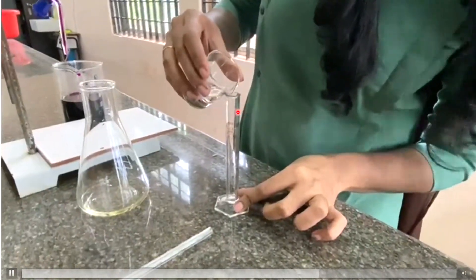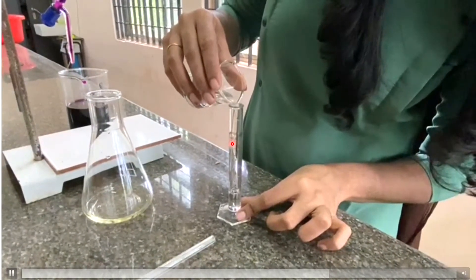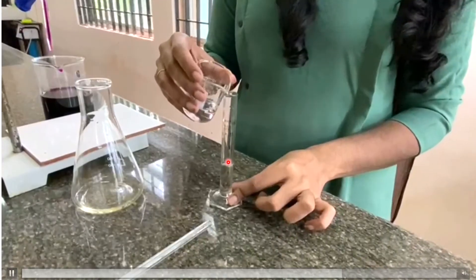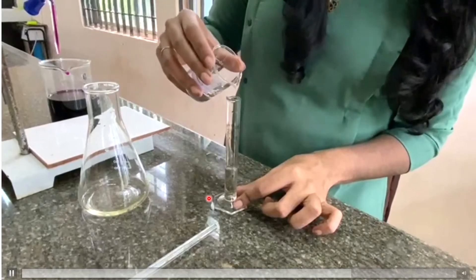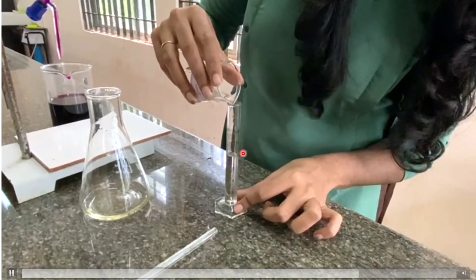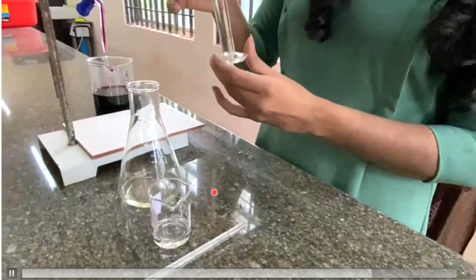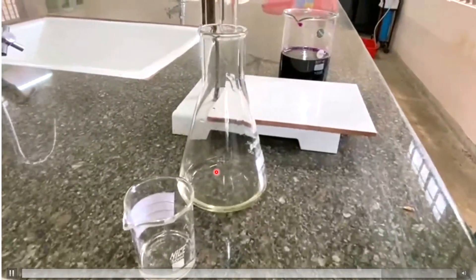Then we add 5 to 10 ml of dilute H₂SO₄ to the flask - a maximum of 10 ml. We measure this carefully.